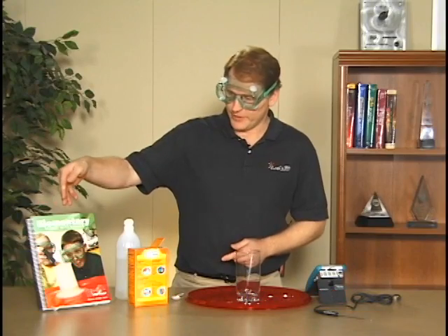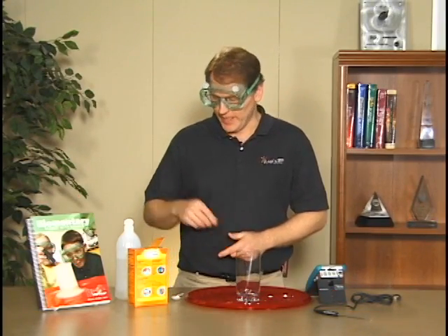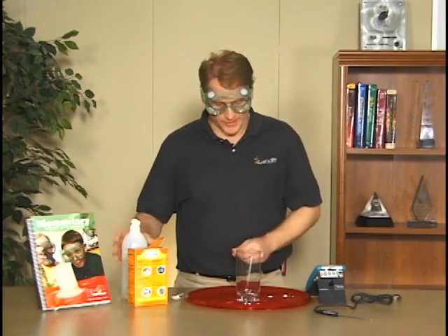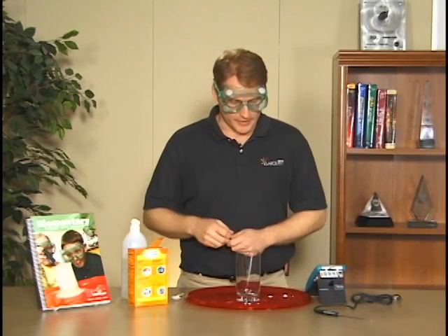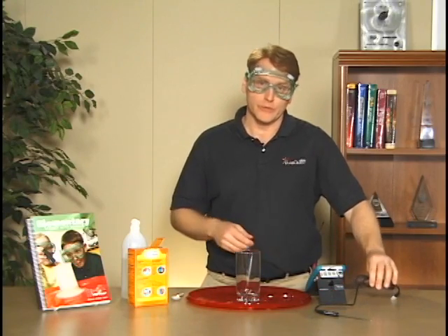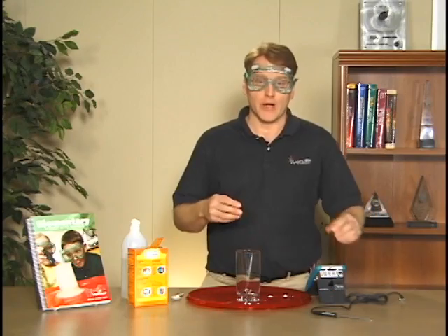Today I'm going to do experiment number five from the elementary with Vernier manual, the cool reaction lab. In that lab we have some vinegar and some baking soda and we're going to mix them together. That gets kind of fun if you look at the cover of the book, but what we're going to do is use the LabQuest and the temperature sensor and record the temperature as that reaction occurs.